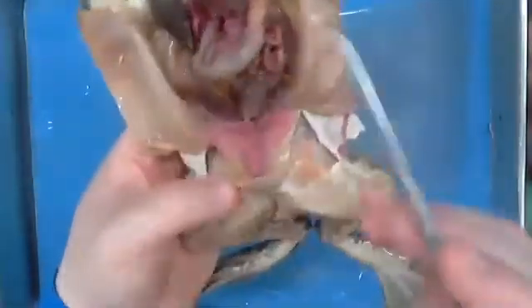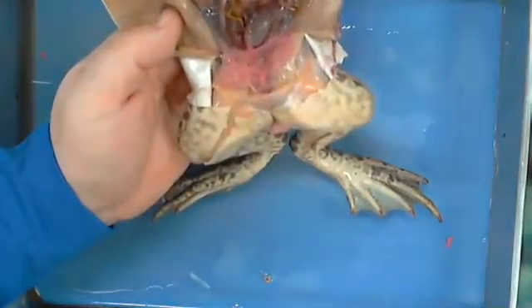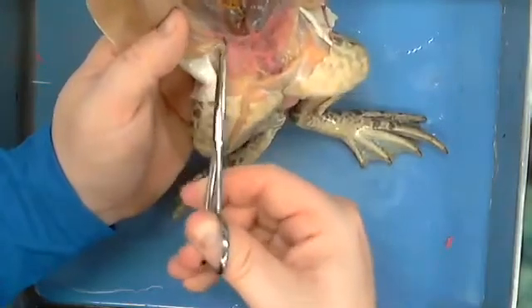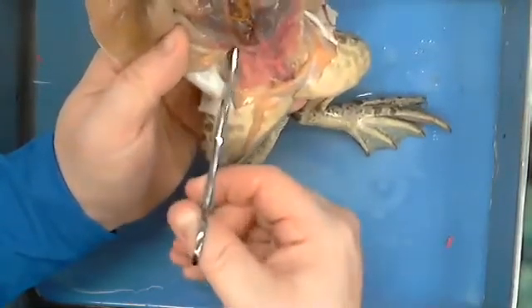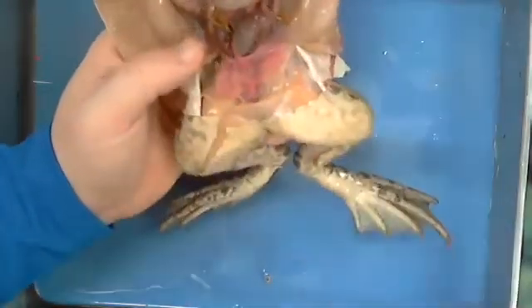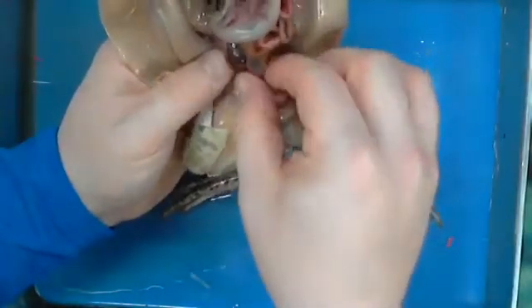All right, so you've basically seen the predominance of everything that he has. This is nothing more here than a bunch of extra skin and extra materials that he has that aren't really doing much for us. But I'm going to show you something because I think you guys are kind of down to what are we missing and what have we not seen yet. So I'm going to show you real quickly, if I can, something else. So I'm going to try to get as much of this out of the way.